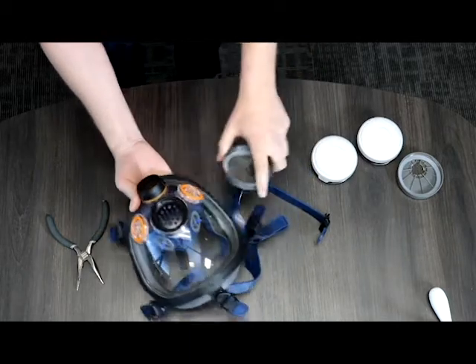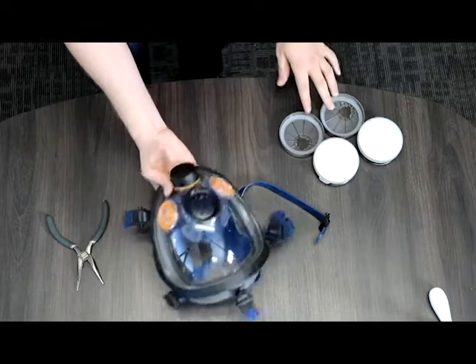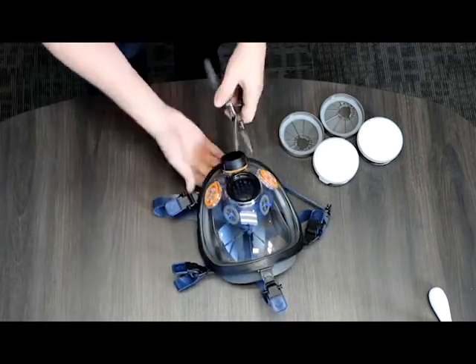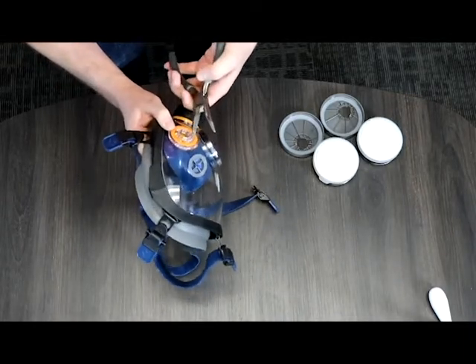So this one's a little bit tougher. Yours are probably pretty tough because they are machine pressed on when they are manufactured so it might take a little effort. Don't worry you're not going to break it. That plastic is soft. It bends but doesn't break.